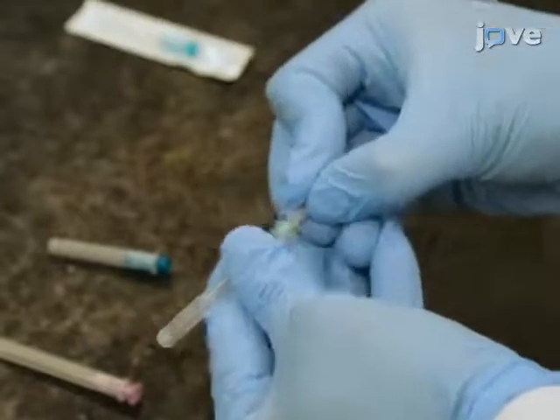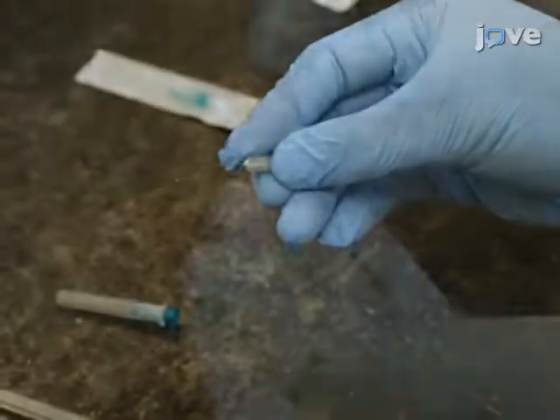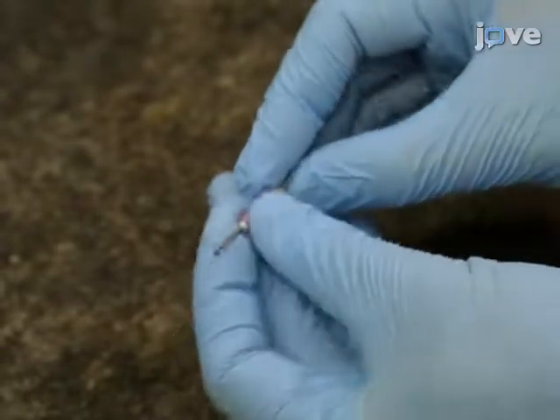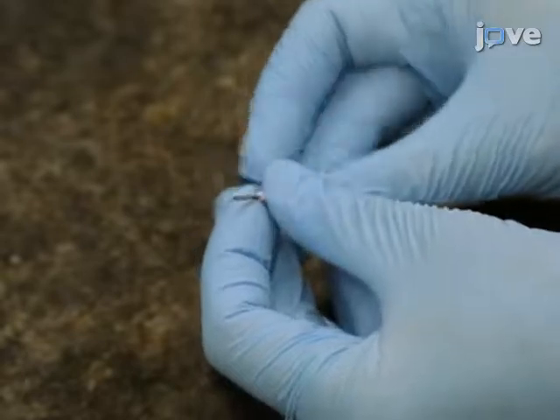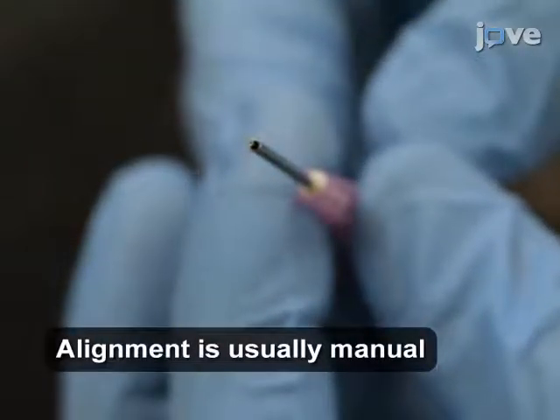To start this procedure, construct a dual-layer concentric microfluidic printhead by inserting a smaller blunt needle serving as the core into the center of a larger blunt needle serving as the sheath. Make sure that the core needle is protruding from the outer shell approximately one millimeter.